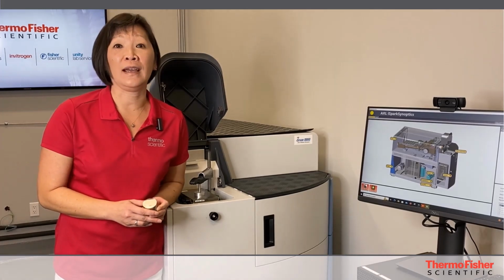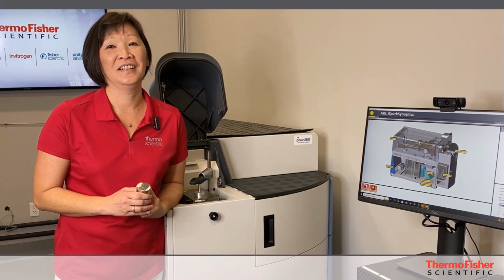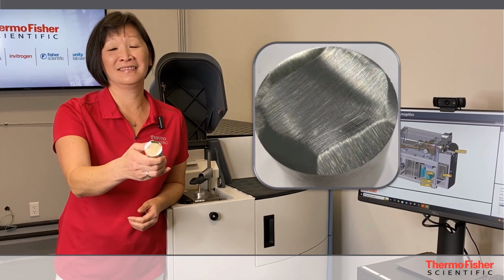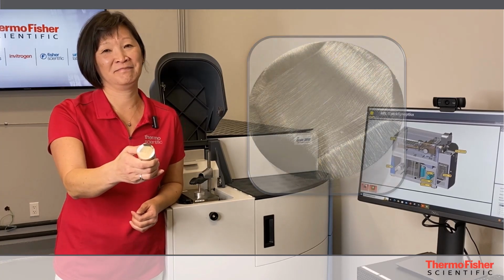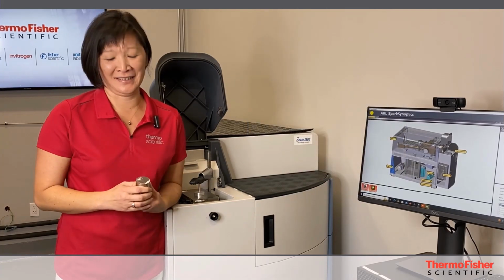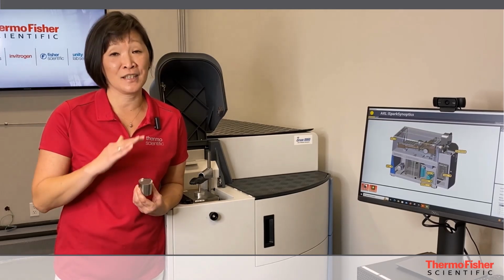Have you ever had a problem grinding your samples to get a smooth surface for OE analysis? I know you have, Ton. Yeah. Wow, that looks like you're trying to make metal jewelry out of an OE sample. Unfortunately, yes. So in today's episode, Glenn's going to show us his technique on how to grind to get a smooth surface.